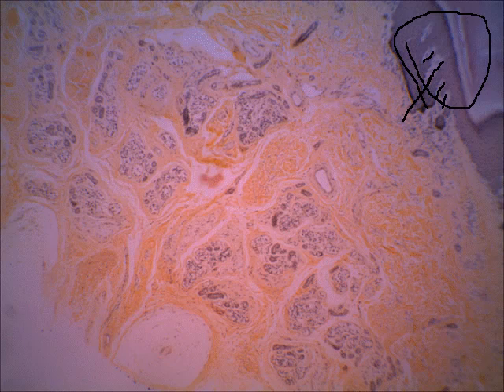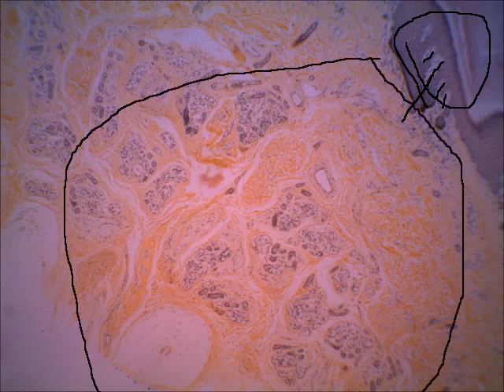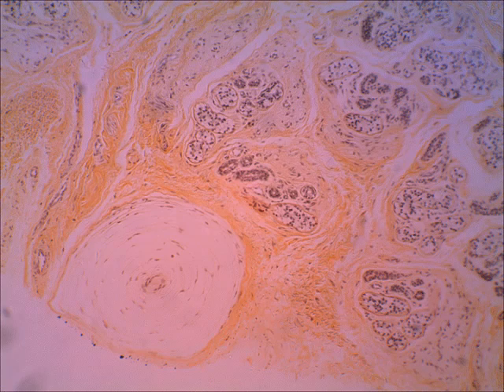But if you look deep in the dermis down here, we're seeing another touch receptor. This is actually a pressure receptor called the Pacinian corpuscle. It can be found deep in the skin, also in some deep internal organs. On the next slide, we'll see this at a higher view.